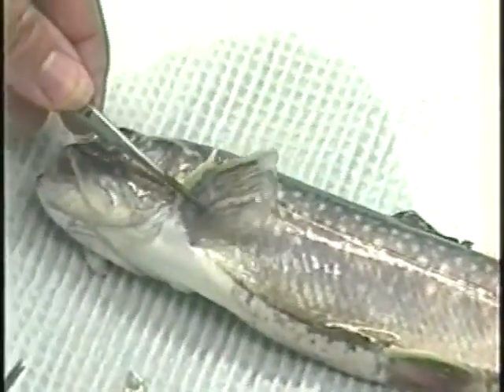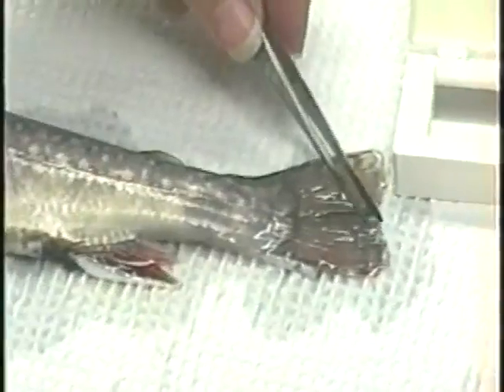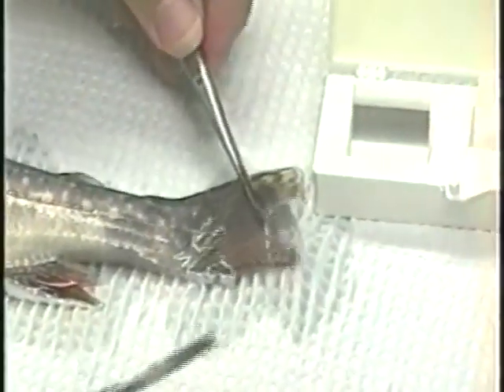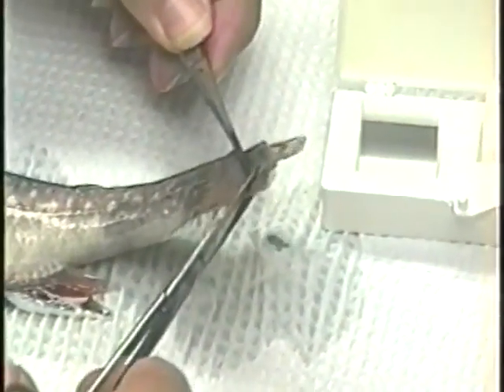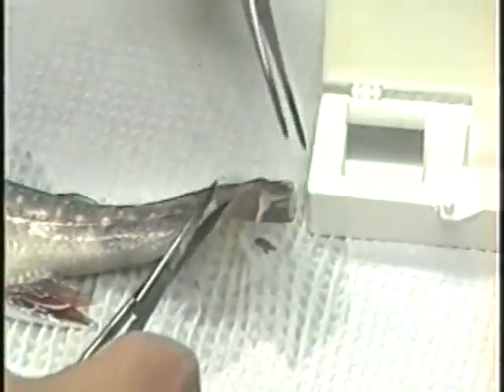On the fins, look for fraying, excess mucus, fungus, and hemorrhaging, and encysted parasites which may be visible as white or black spots. A portion of the fin may be clipped off and placed on a slide with water and a cover slip for closer examination.